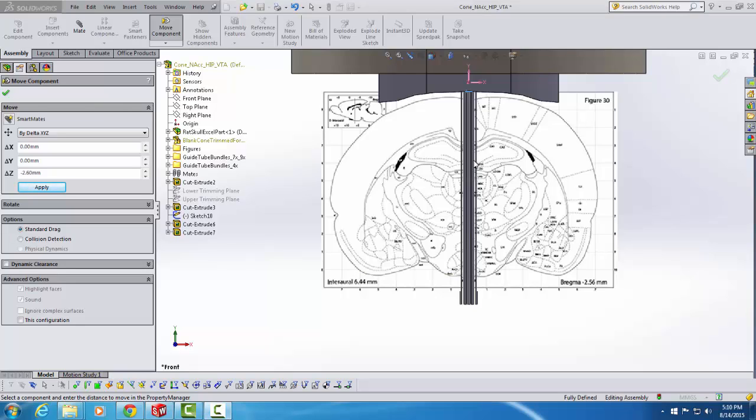Now before I move the bundle laterally, the first thing I'm going to do is go over here and set this delta Z to 0, because I don't want to move along the Z axis anymore. I've done that. And then I'm going to go to delta X, because that's the lateral axis here. I've decided that I'm going to center the bundle at 2 millimeters lateral from bregma at this point. So I'm going to hit 2. And I'm going to put this bundle on the right side of the brain. Since I'm viewing this from the front, that's actually going to correspond to a leftward shift of the bundle. And in order to get a leftward shift, I need to make the 2 a minus 2. It's got to move in the leftward direction.